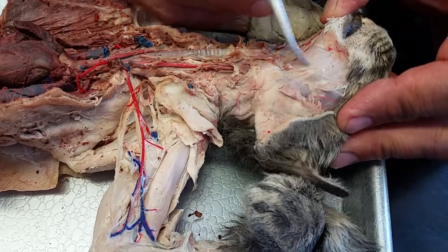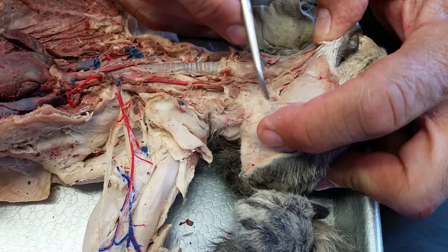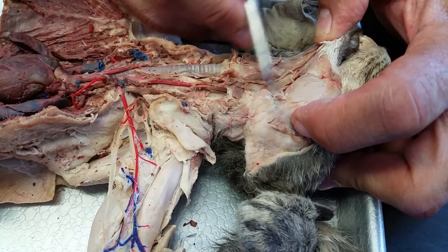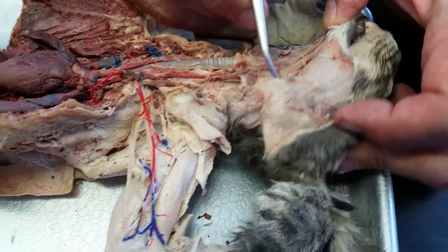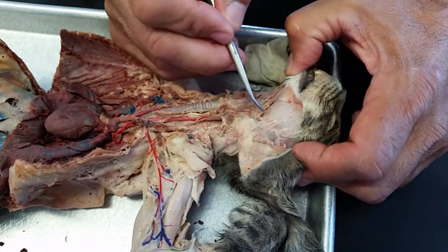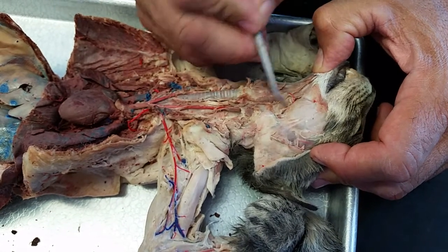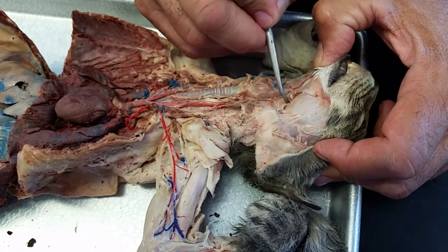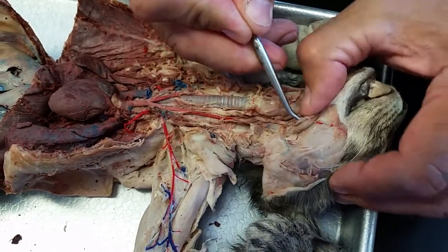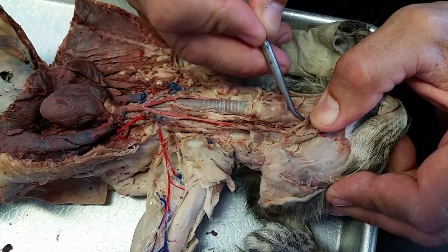Where's the parotid gland? Right there. That's the parotid because this right here is the submandibular — it's underneath it. See the angle of the jaw come off it? That's the mandibular gland. Here's the parotid gland, here's the parotid duct, here's the dorsal facial, and the ventral facial is broken under here. This is the digastric muscle — move that out of your way and you can find the hypoglossal nerve right there coming into the tongue.